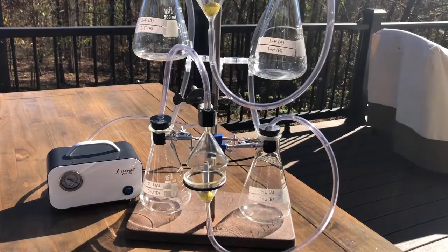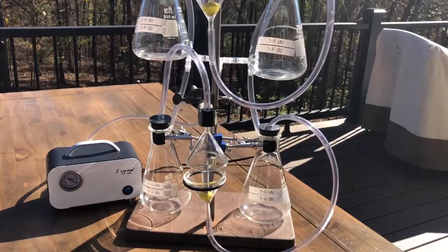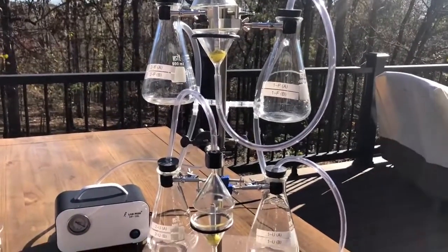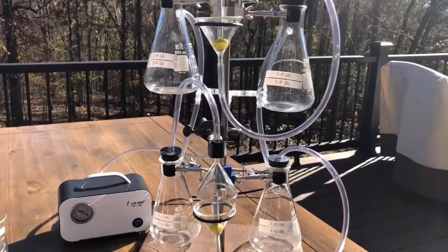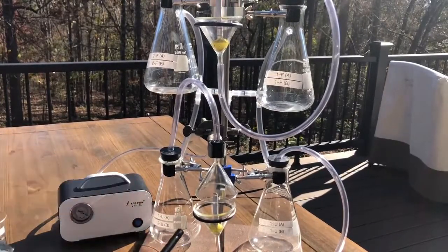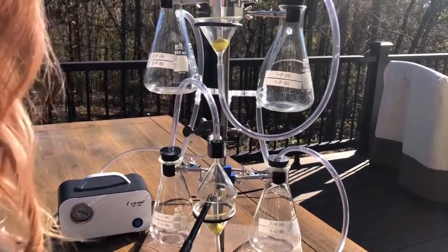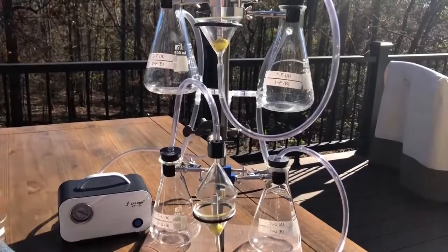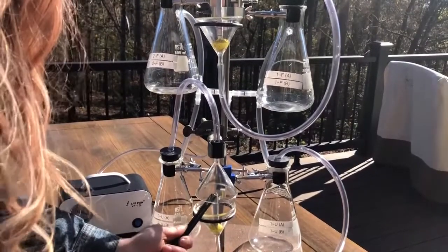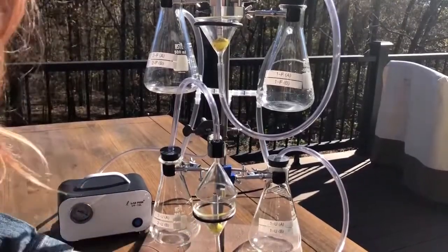I really squashed on those rubber stoppers to make sure they were in there nice and tight. So now we are going to try it again and see how we do. Fingers crossed, because it seems the wind has picked up, which is not what I was hoping for, but hey. Come on. You know, it would help if the torch lighter worked. There we go. All right, that looks positive.